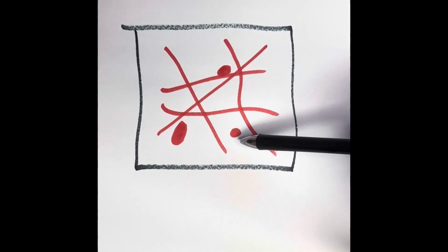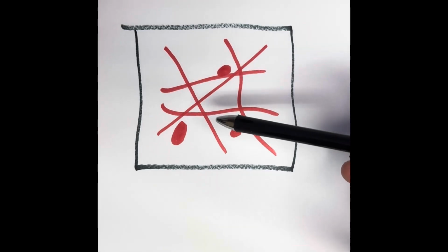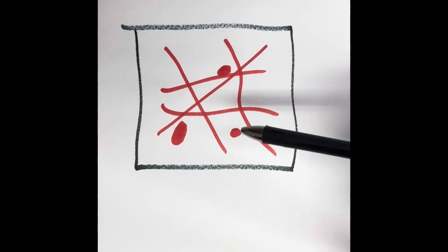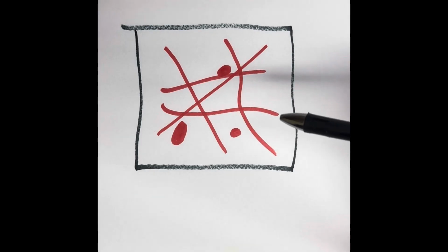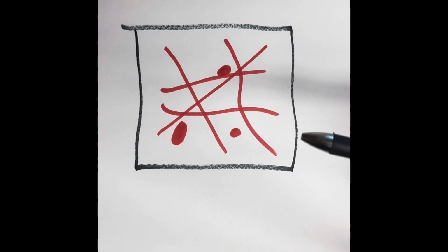They're scattered and arranged in various types. One of the things to remember about this particular fibrous connective tissue is that it does contain ground substance and it does have blood vessels. Its function is to loosely bind the epithelial tissue to the surface and provide blood vessels for nutrients to the epithelial tissue.